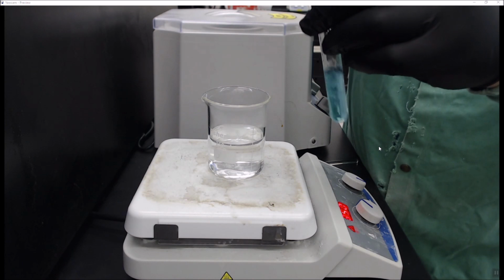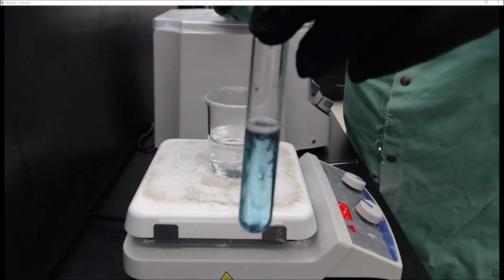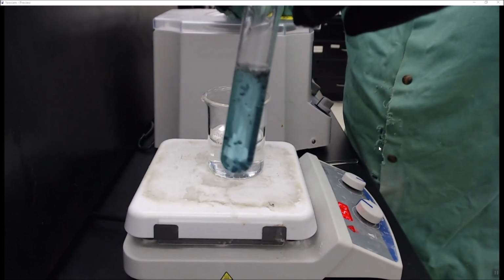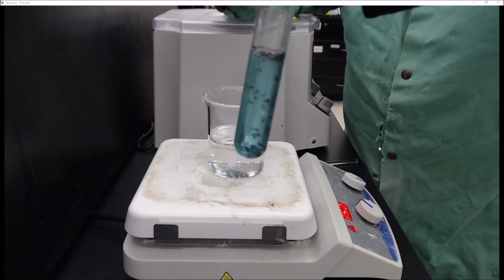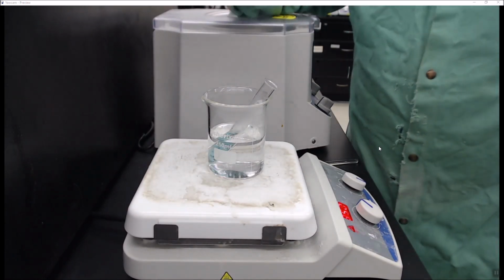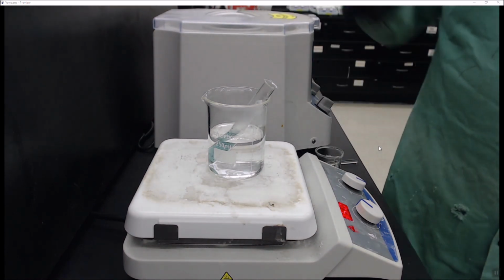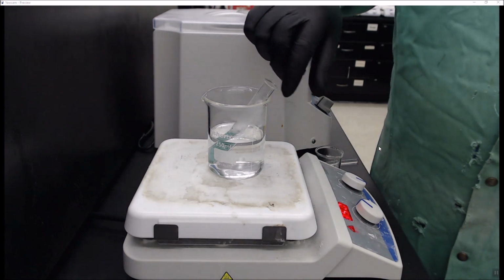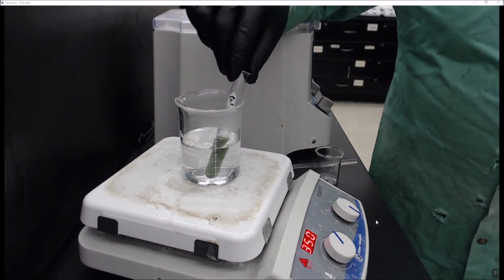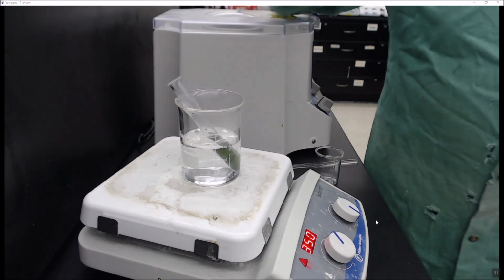Alright, and if you look closely, you can start to see things floating around. You can see a little bit of fizzing. Now that's going pretty good, but we want it to go faster. So that's going in our hot water bath, which is a beaker with 150 mils of water set to 350 degrees. Because this is a volatile reaction, I want this to point away from me and my classmates.